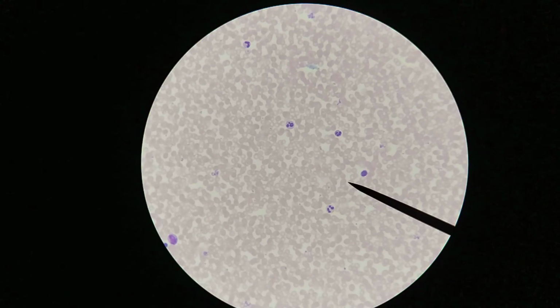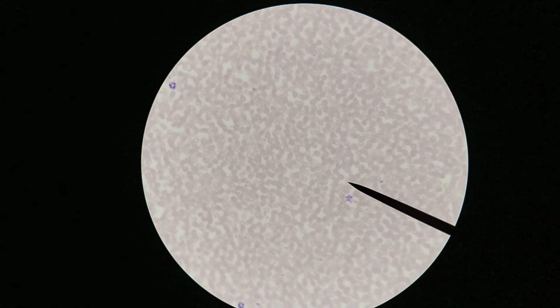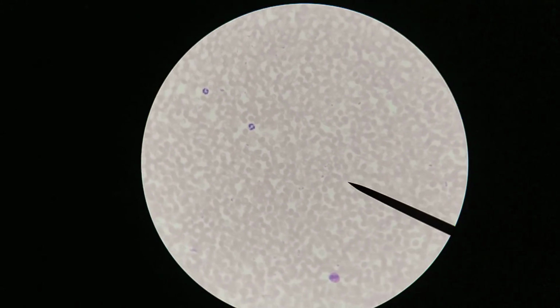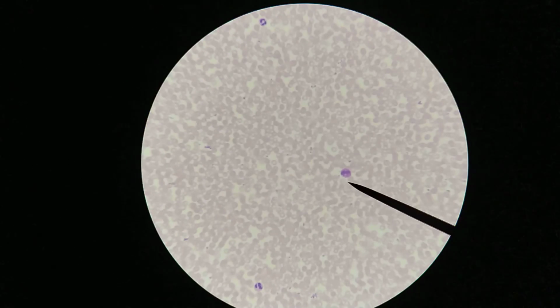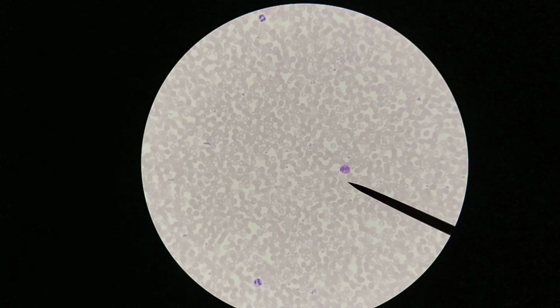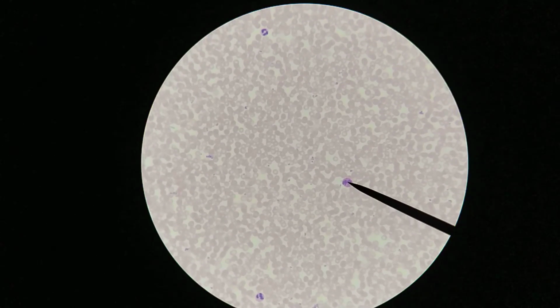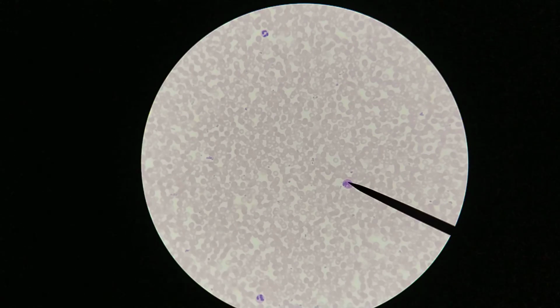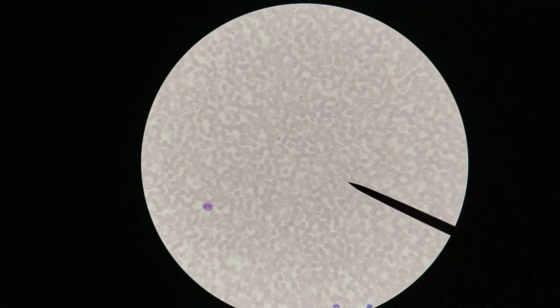Again, more lymphocytes and more neutrophils. And that makes sense because those are the more common cell types. And again, here's another eosinophil showing up in here. Again, a bilobed nucleus and an eosinophilic cytoplasm. It doesn't look very granular, unfortunately, but it's just the level of staining, and unfortunately, I can't go to higher magnification to give you a lot more detail from this one.